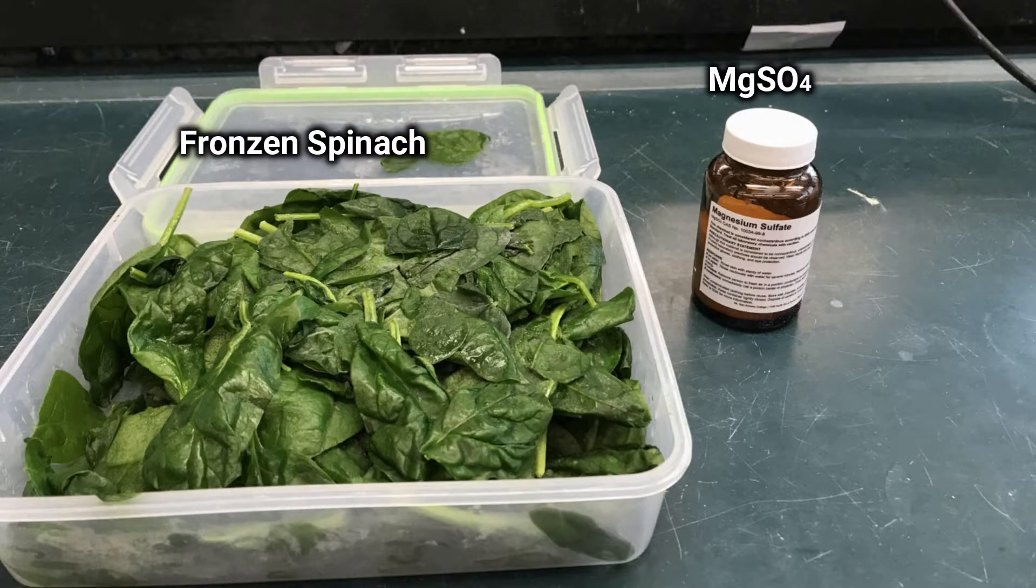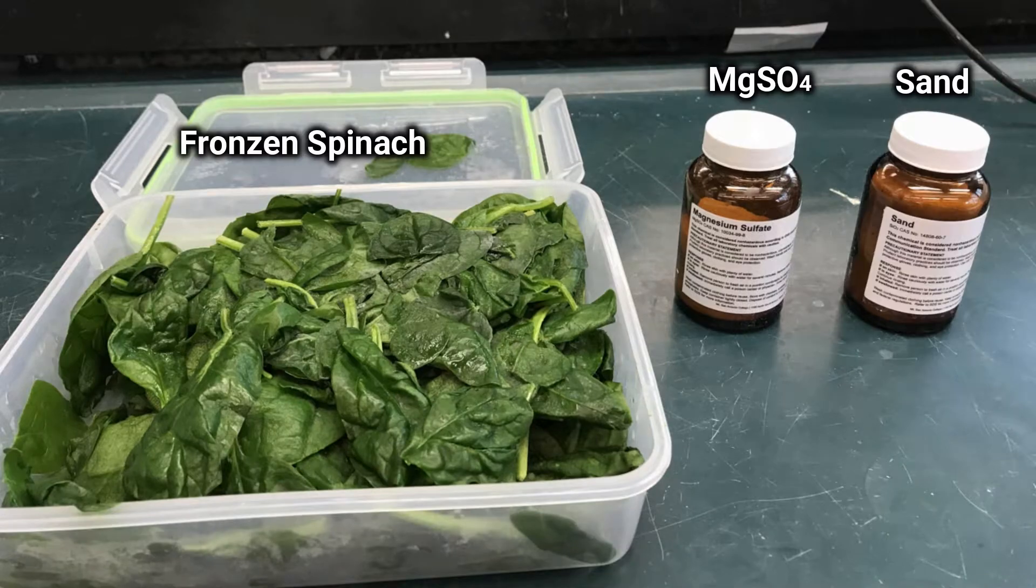You will need frozen spinach, magnesium sulfate, sand, and a mortar and pestle.